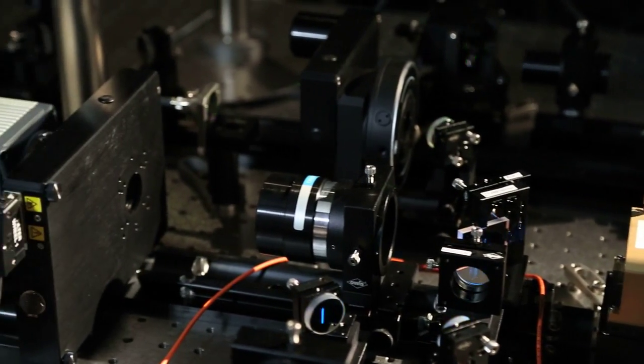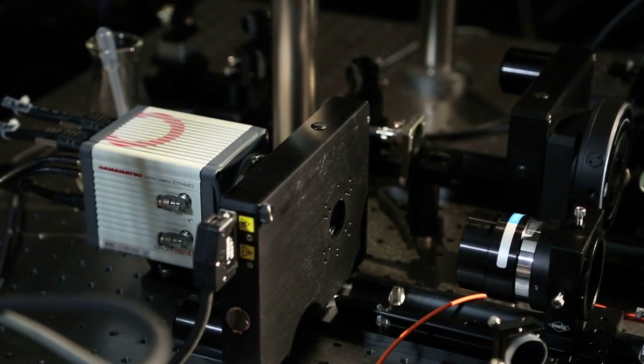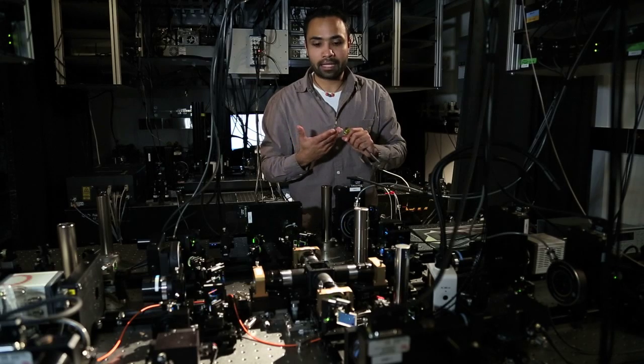And one other ingredient we need for that are the cameras. So the cameras also need to be looking at their respective light sheets. These cameras have a mode that allows us to do that in the confocal line scanning mode.